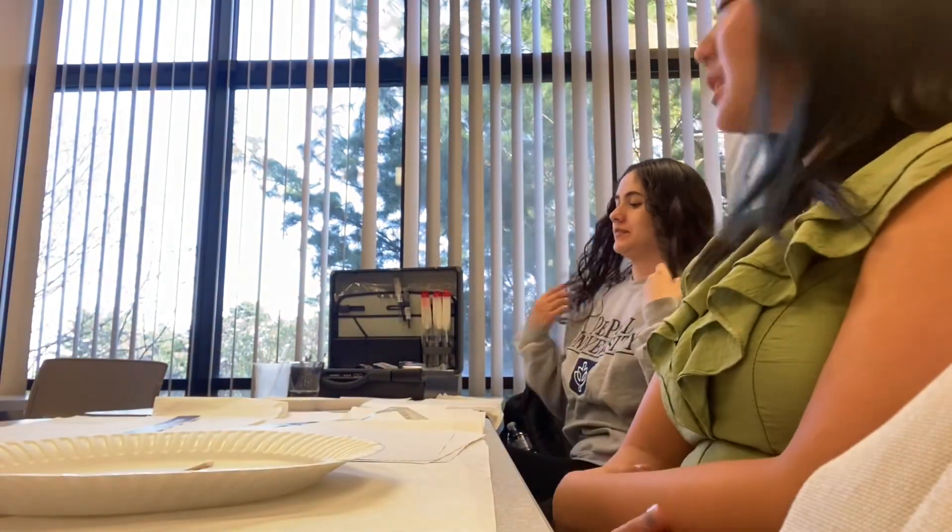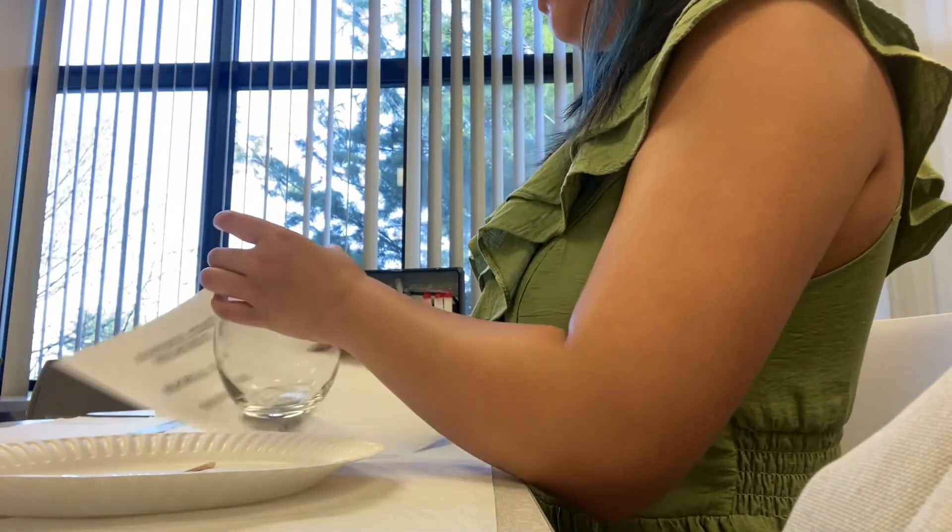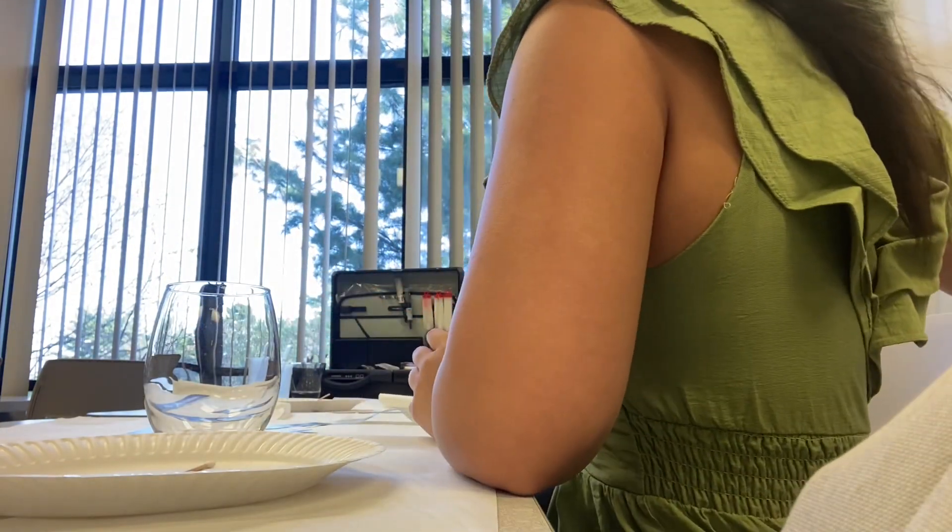You can use the hinge lifters. As you pull this piece apart, you place the sticky side. That print or whatever you have should be on the sticky side, and then you lay it down just like this. You guys should have gloves — actually, we're supposed to be wearing gloves while we're doing this.